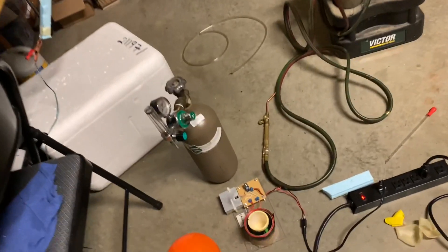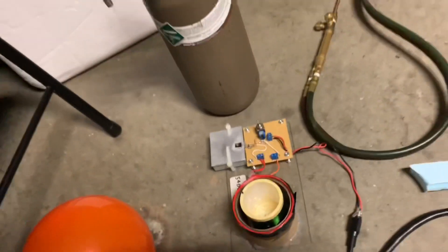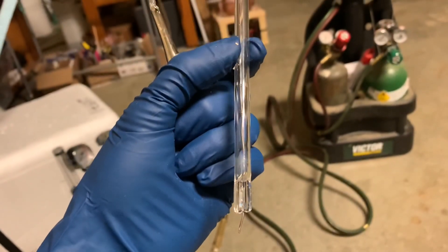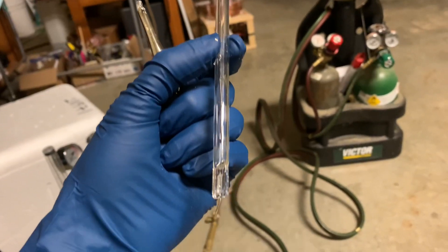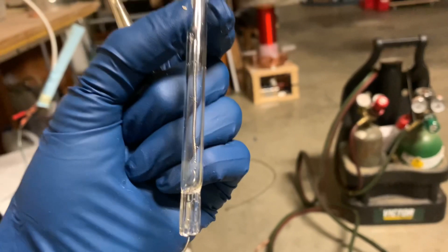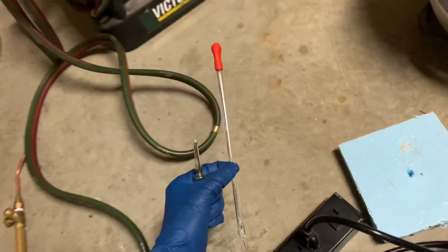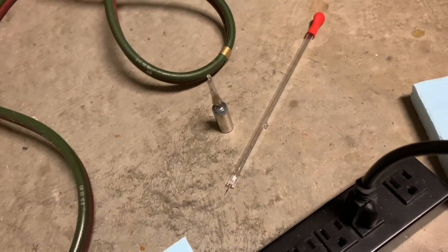To test that the tube has sufficient vacuum, I have a small Tesla coil. Here's my other tube — this one is made of quartz, which I think may react with cesium, so this may not be successful. This tube has also been filled with argon gas. We're going to get some cesium in the bottom; this one has a small tungsten filament in the bottom. So we have a collection of tubes that we're going to try out.